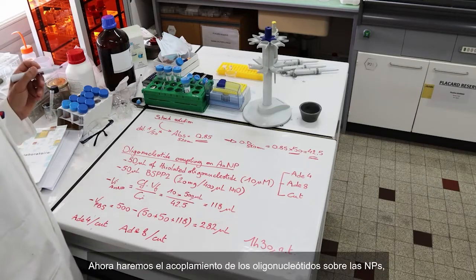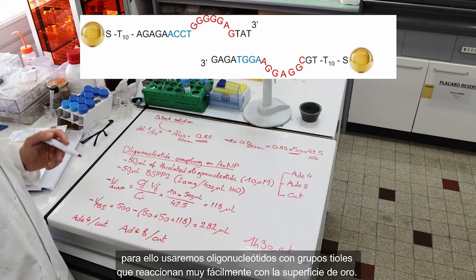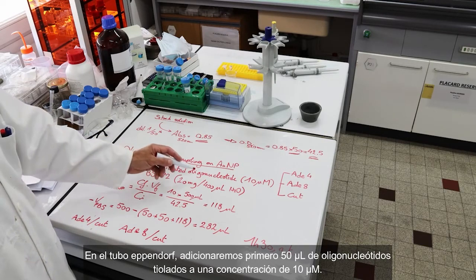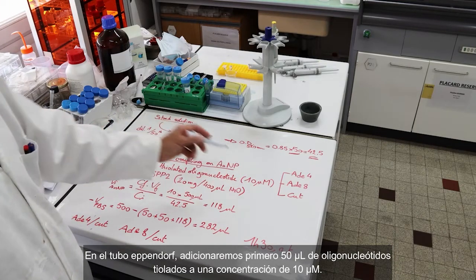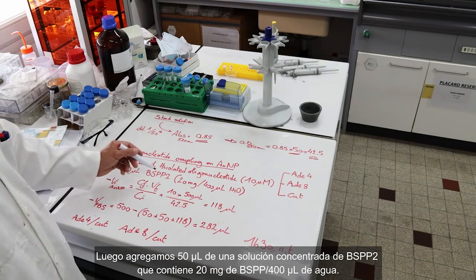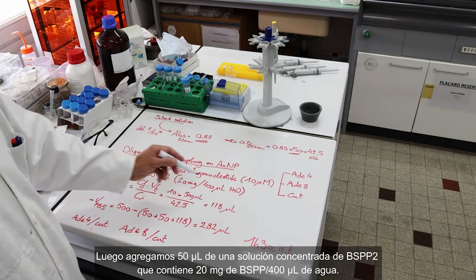Now we will do the oligonucleotide coupling on the nanoparticles, and we will use oligonucleotides that contain a thiol moiety that will react very easily with the gold layer. In an Eppendorf tube, we will first add 50 microliters of thiolated oligonucleotide, which has been diluted to 10 micromolar. Then we add 50 microliters of BSPP2, which is a more concentrated solution containing the phosphine. This solution is made of 20 milligrams of BSPP diluted in 400 microliters of water.